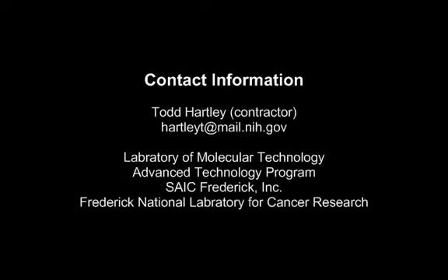I hope that gives you some idea of how the method works. By running the method in simulation before you use real hardware, trying to understand how it works, doing the modifications you need to do for your particular system, hopefully you can get this up and running and save some time to do library preps. I hope you understand that by using procedures, you can save a lot of time in writing a method by making, for example, the add reagent procedure. Once that was developed, it's used multiple times in the method. Instead of serially writing the whole method, rewriting those steps again and again, just make it once, just call it a bunch of times where you can change the variables you set up. It helps in maintaining the method.